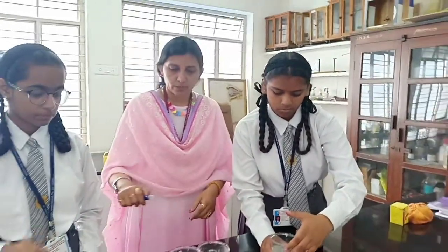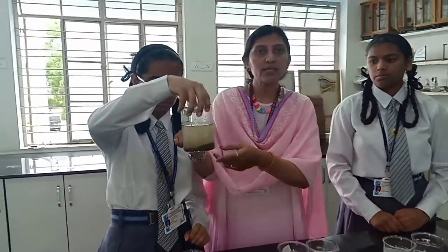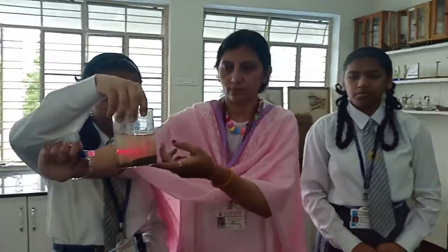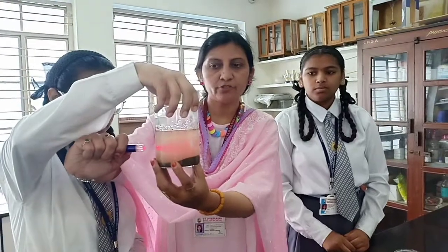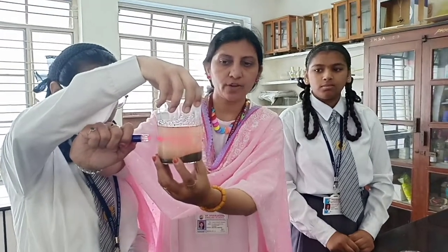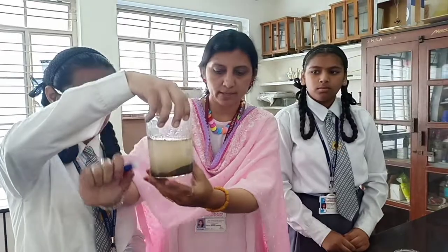Now we will see the Tyndall effect — we will take the suspension of the salt sand water. See how the effect shows the scattering beam of light. The effect shows how the beam of light passes.